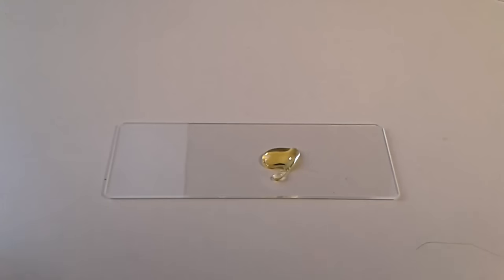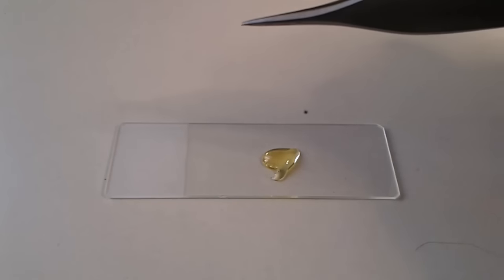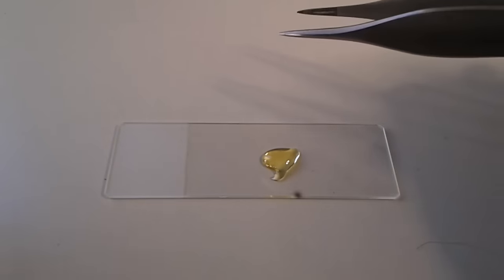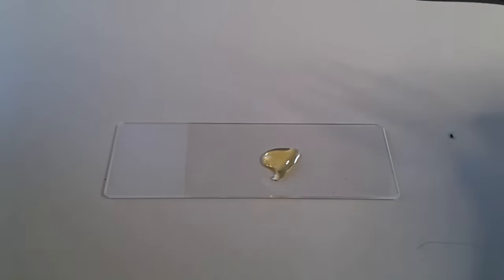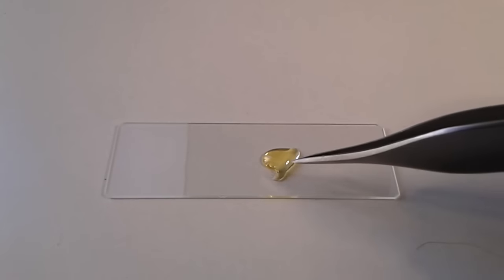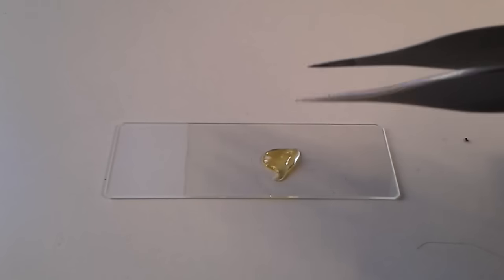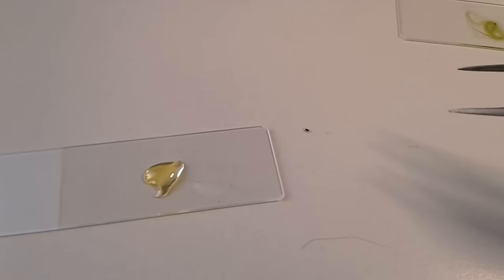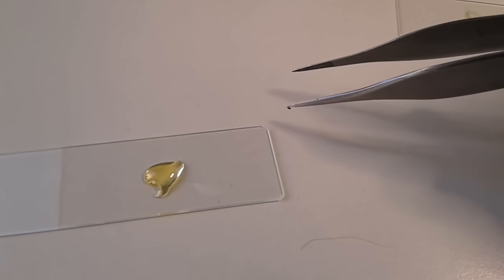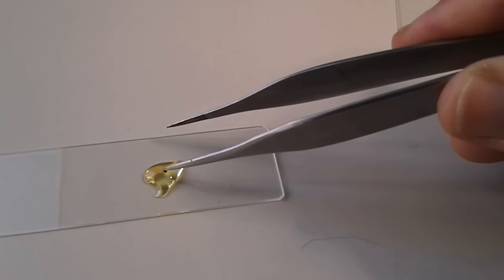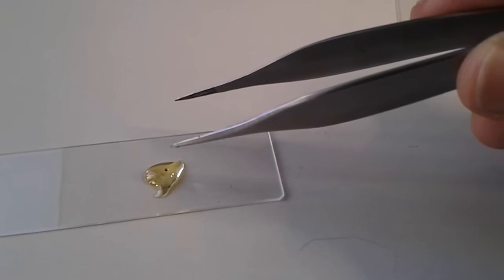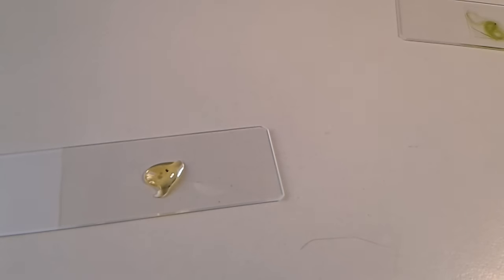I tried to put it directly into the mounting medium, but it didn't want to go there. So I tried a little trick: I simply dipped my tweezers in the mounting medium to make it sticky. Now it's easy to pick up the spider. I know it's maybe not a very nice thing to do, directly mounting a living specimen in mounting medium like this, but the cover glass has to be placed on top.